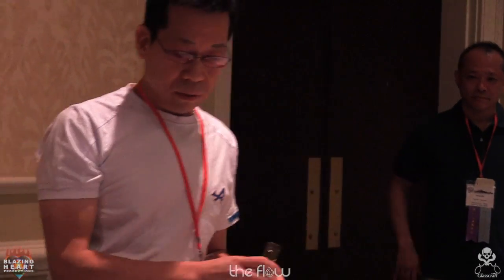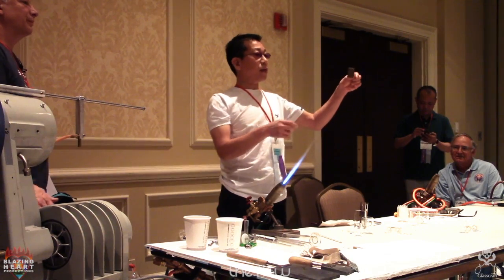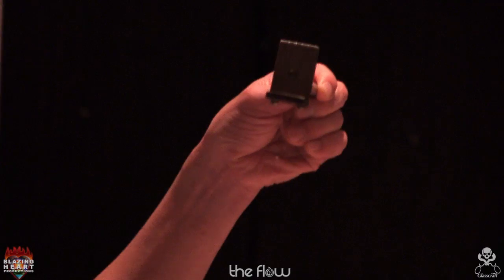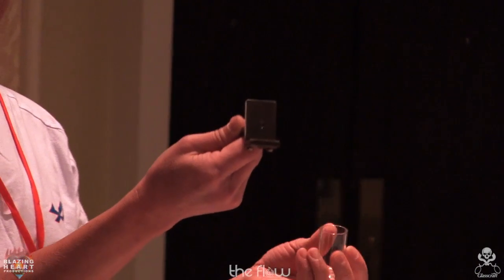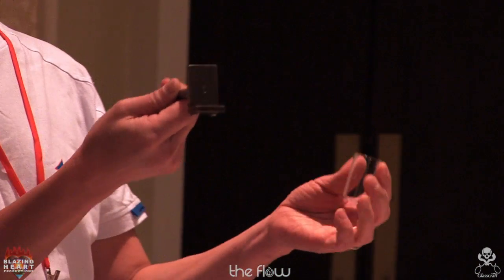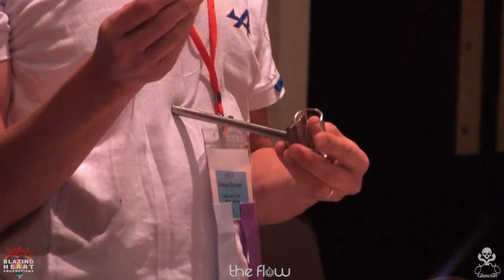So I've already explained. You can continue. The body part is stainless steel, 90 degrees. It's got to be accurate because that's going to hang on to the sidearm. Here you put the flask on. And he's got a very nice stainless clip.